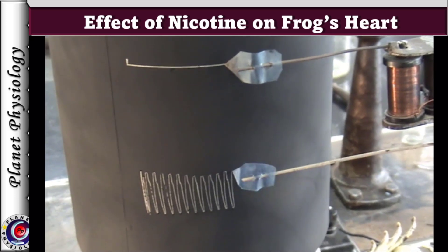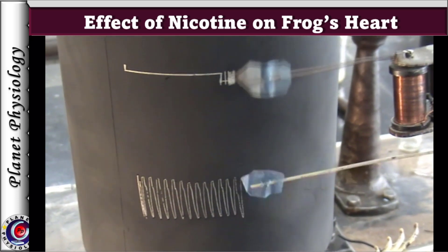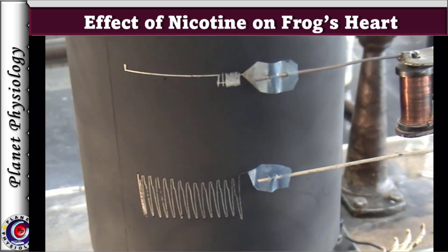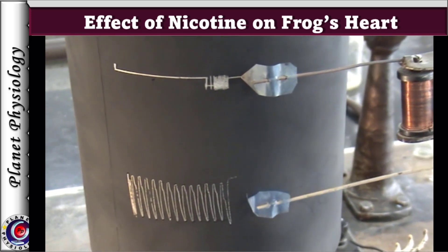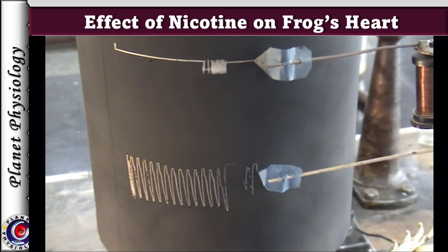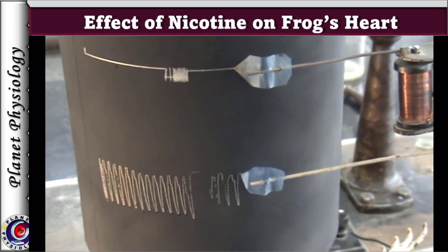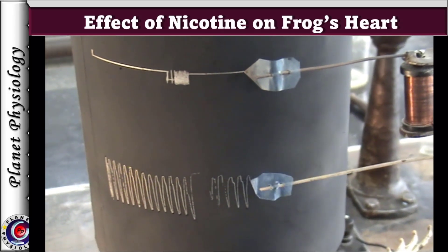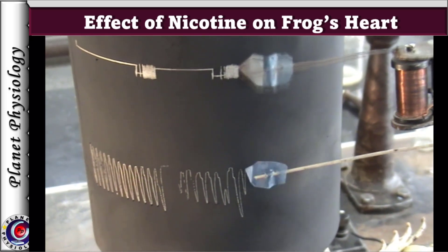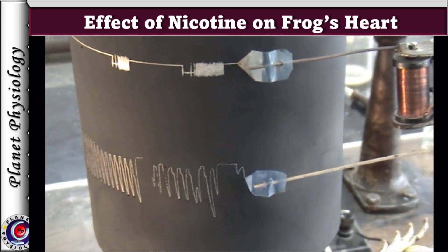The vagus nerve is briefly stimulated, causing the heart to stop momentarily in diastole. Once the heart resumes beating, the crescent is stimulated, again stopping the heart in diastole, followed by gradual recovery.